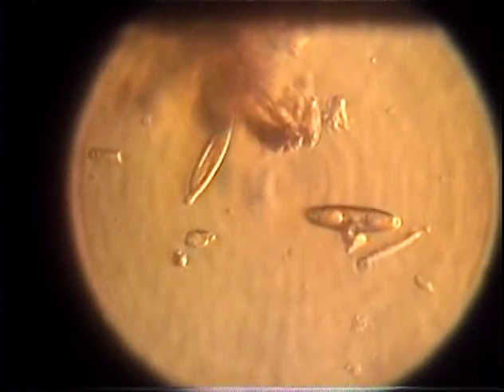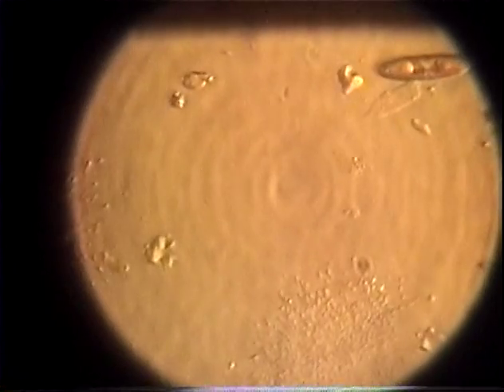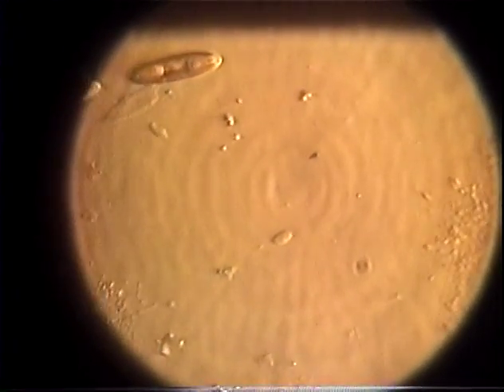See how they're moving? They look like some sort of fish with wires. It looks like they're on wires, right? They move like there's some sort of unnatural wire mechanism moving. That's their cilia that's causing that. Cilia, C-I-L-I-A.